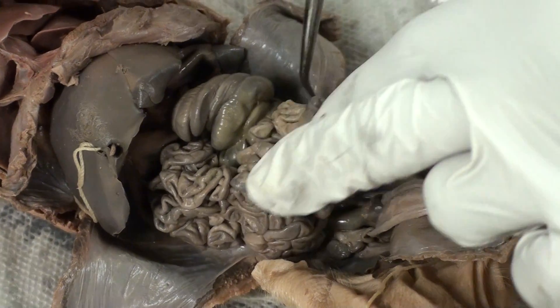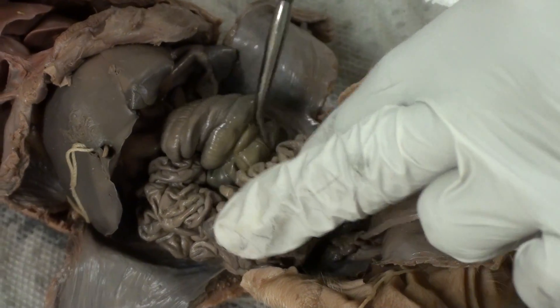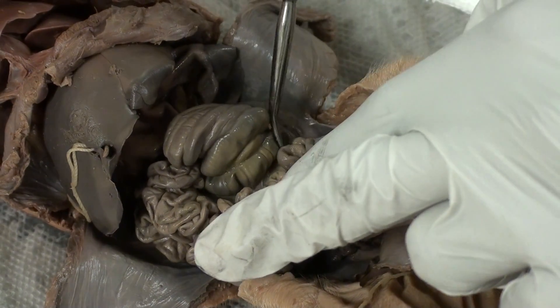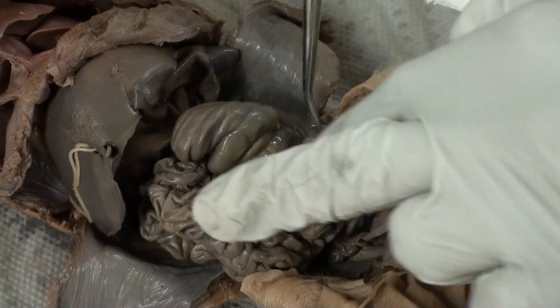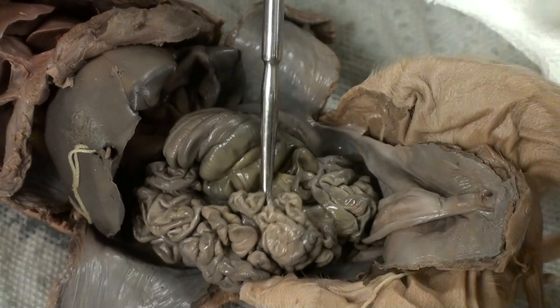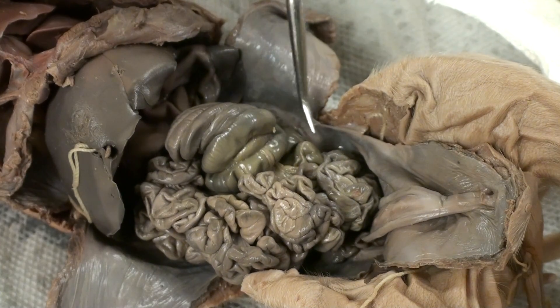Located beneath, between them, when you trace down to the last coil is the cecum, which is the thumb-like structure right over here.